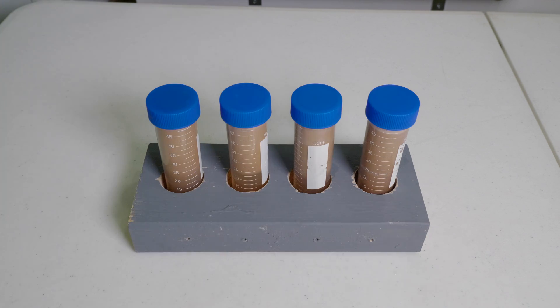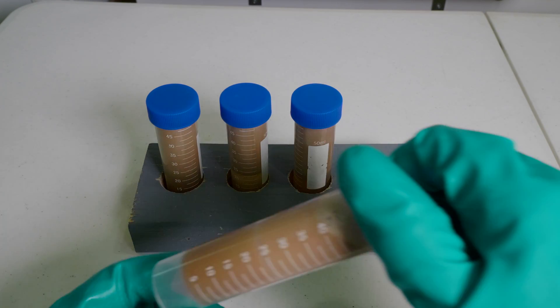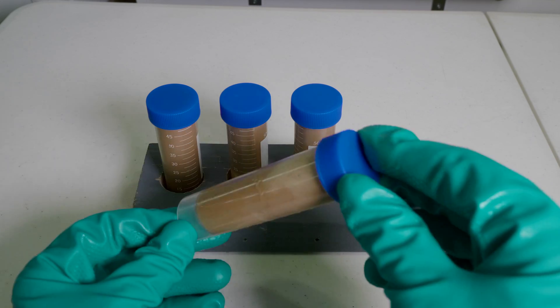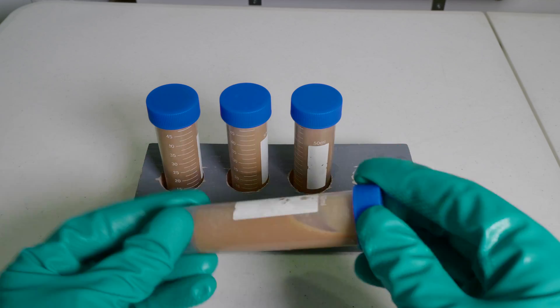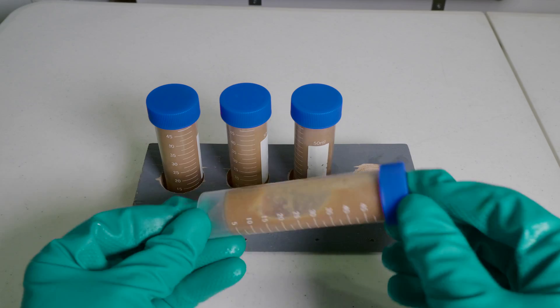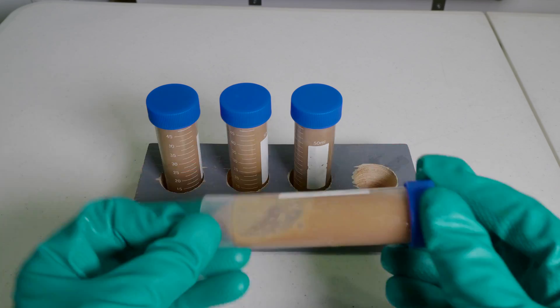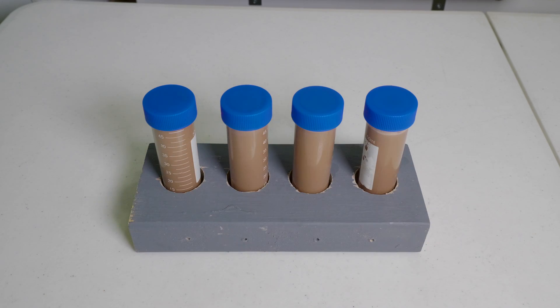Now that the lids are back on, we are ready to move to the next step, which is basically just giving these vials a little bit of a shake, sort of a delicate mix. I don't want to go crazy and create a lot of bubbling action in there. We want to mix up the yeast with that glycerin wort solution so it's really well distributed. After that is all mixed up, next step, we're just going to put it in the freezer.